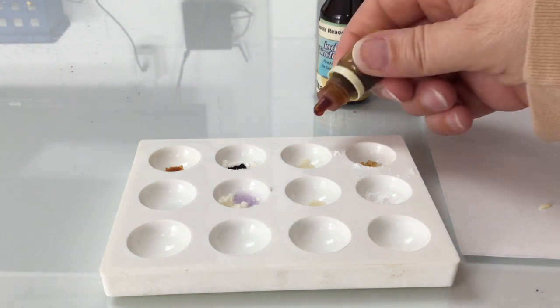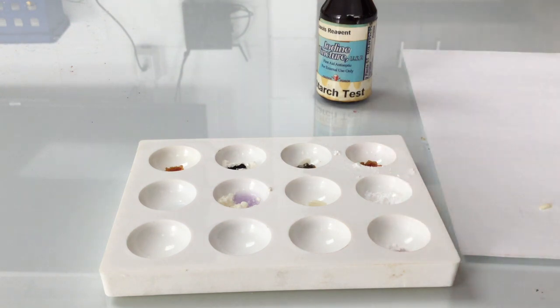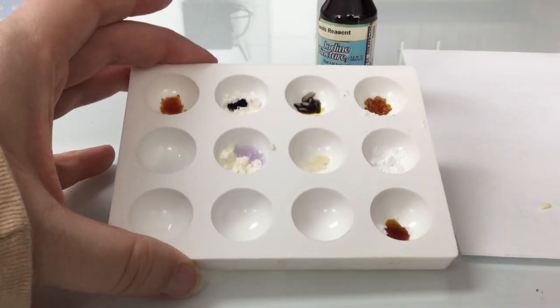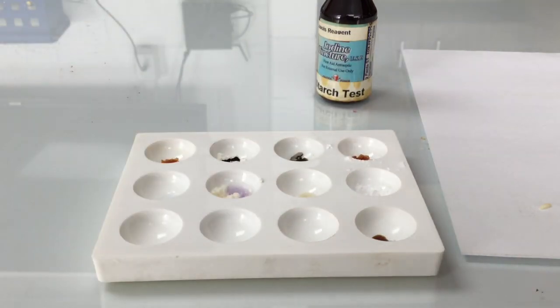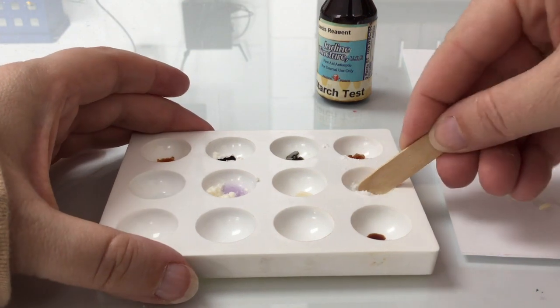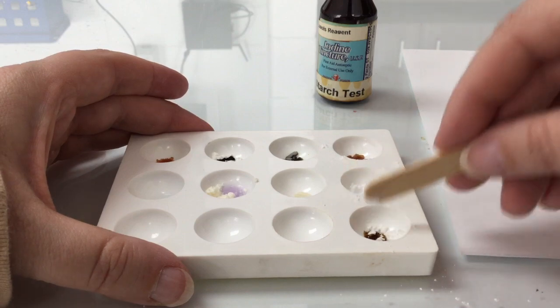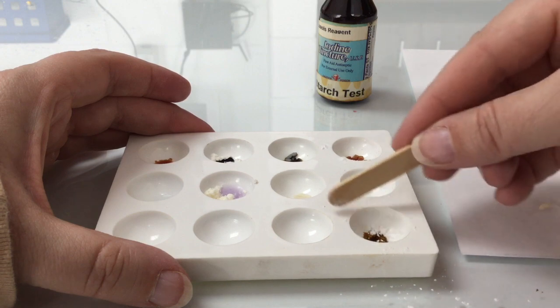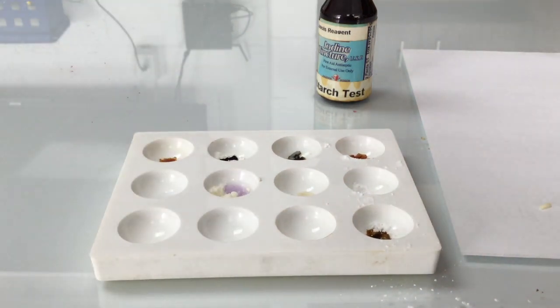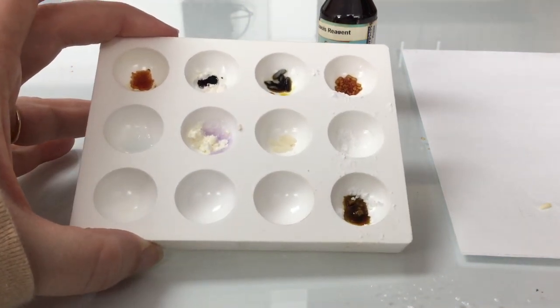So remember that the top row, we are testing for starch, and we are testing rice, and we are testing sugar. And then at the bottom, we have the powdered sugar, which we have also put the iodine in. This test reacts pretty quickly. So we can see there's definitely some starch in the rice. I'm going to try and add some more of the powdered sugar since it kind of landed to the side of the powdered sugar that was in that hole, and we'll see how that reacts. So you can see after some time has passed that it is clearly much darker.